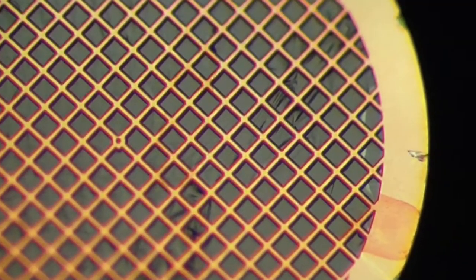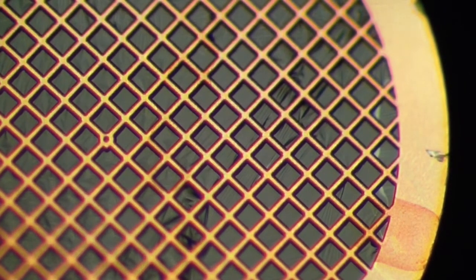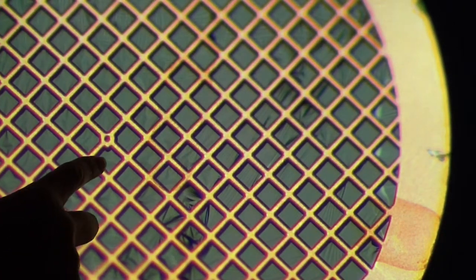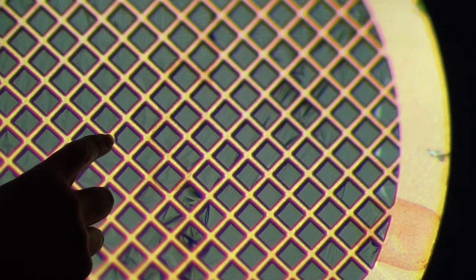Looking at the back of the grid on a dissecting microscope, we can see a thickness to the bars with the substrate on the other side. So this is the non-substrated side and we can see that there's texture. It's not all smooth, which the substrated side would be.